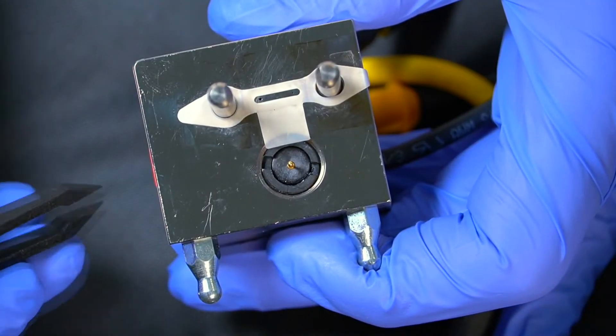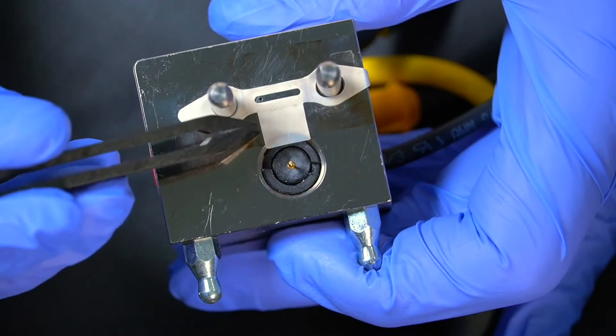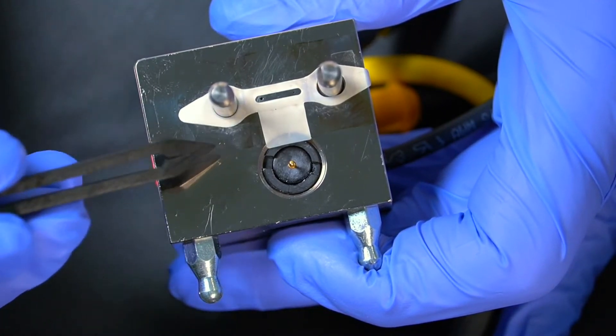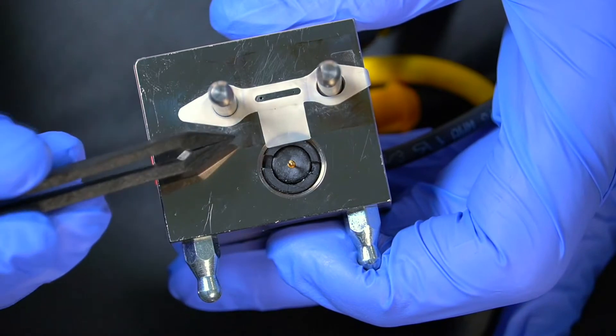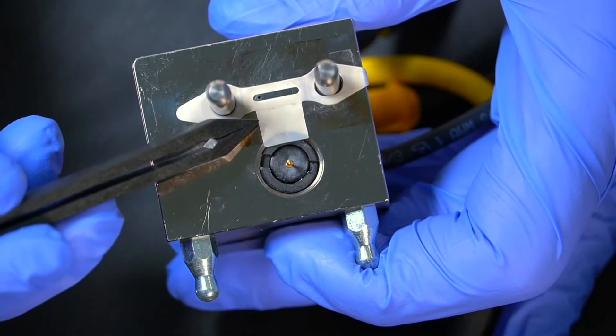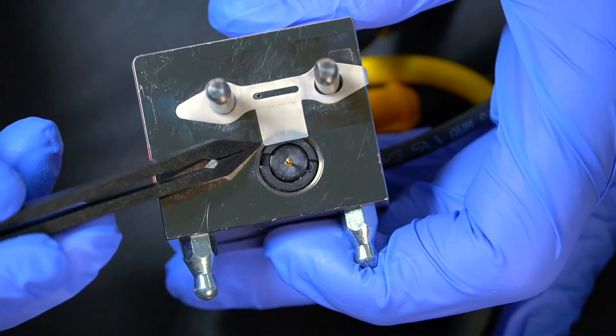When you open the cell up and remove the electrode, you'll see underneath the electrode is the gasket. The gasket here is for a disposable electrode, and I can see that because I can see this little tag.